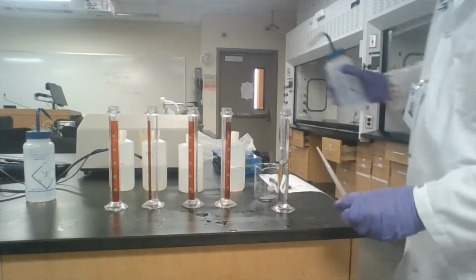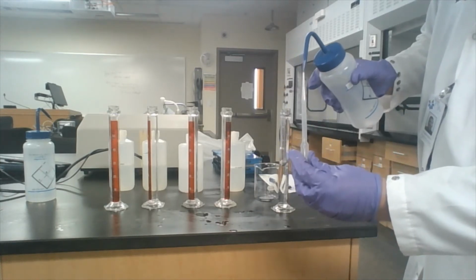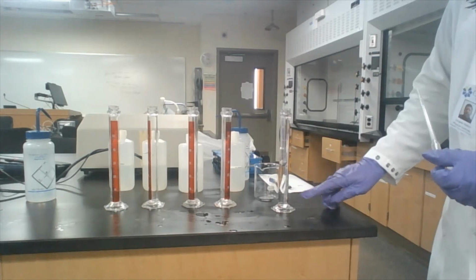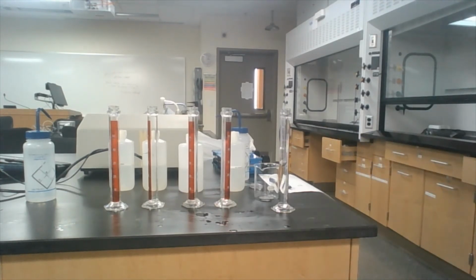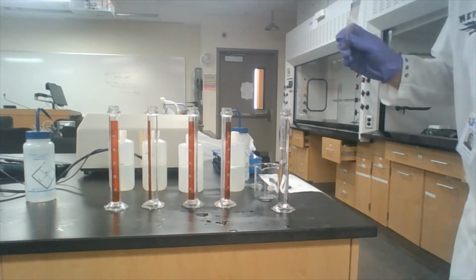And then what I did is I put enough water in here to fill up about 1 centimeter. Okay, and then what we've done here is we've suspended this in a purified water solution, which is our 0%. We're going to measure the amount to which our water-filled hydrometer floats in each solution, and that will tell us the concentration based on the relative buoyancy.